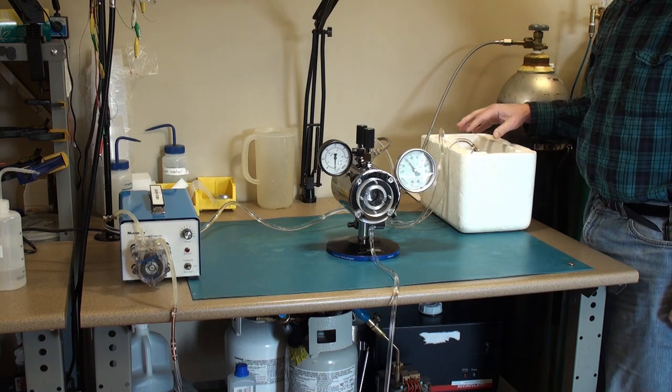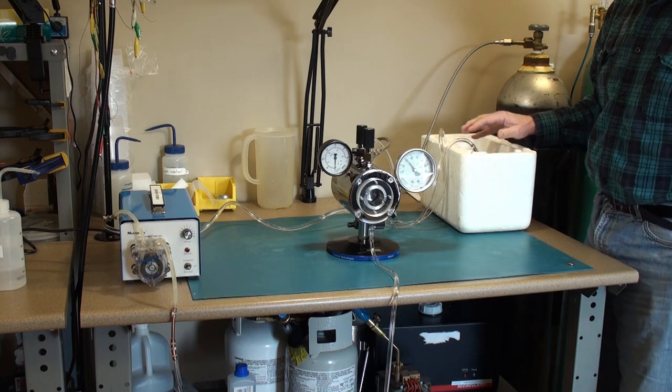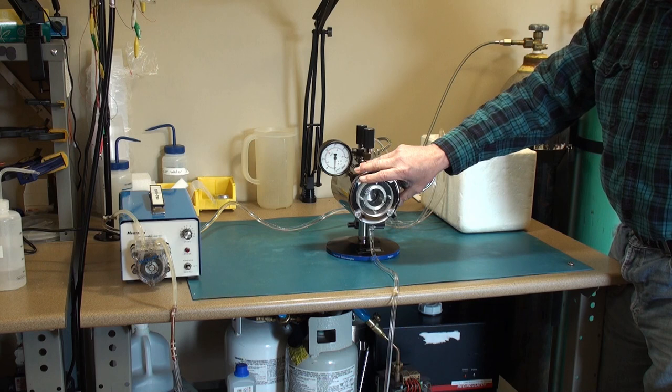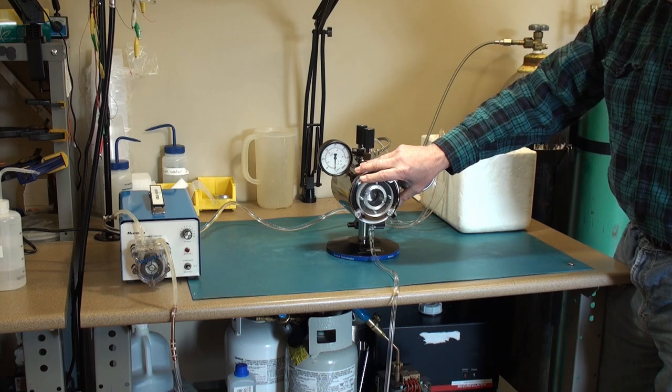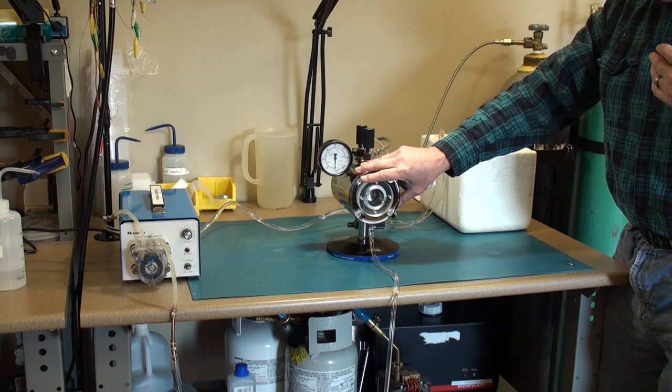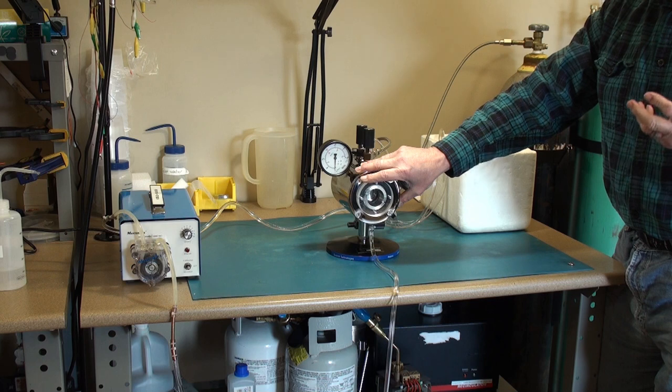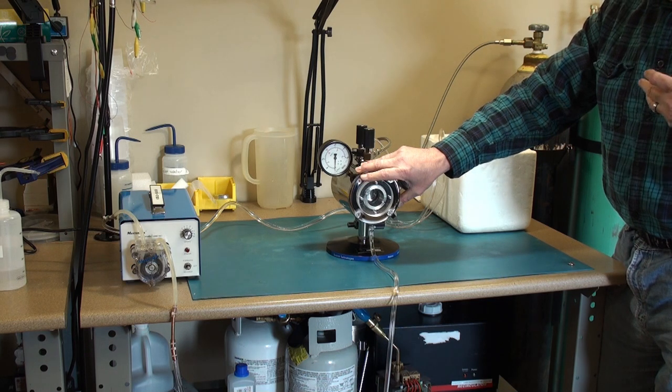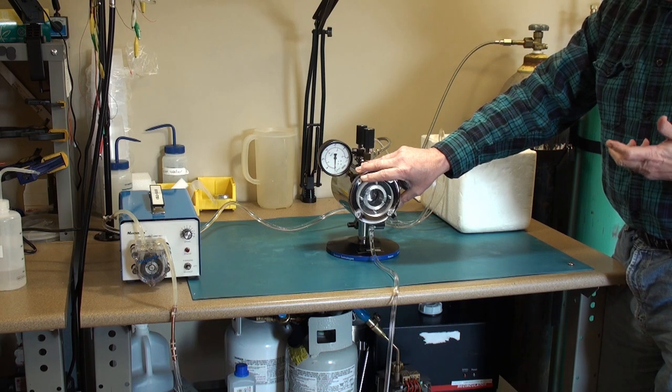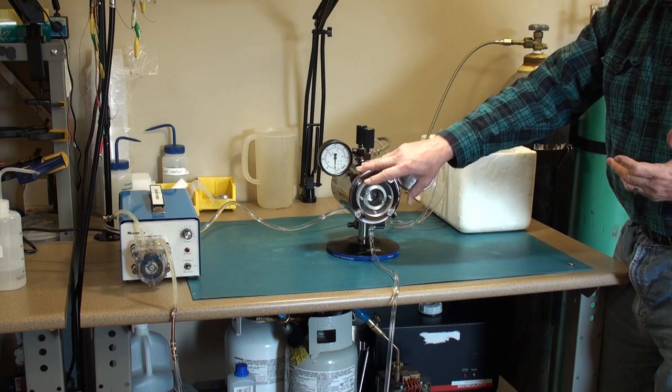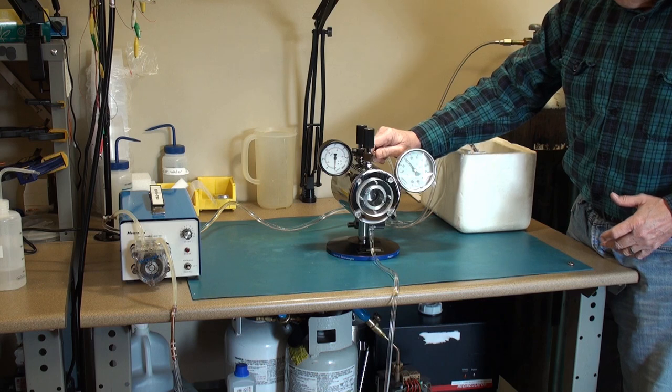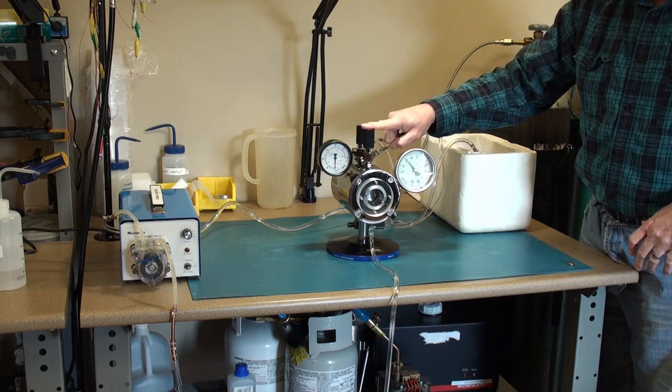To make the water temperature go down to 4 degrees. It does take quite a bit of time for this mass to cool down to 4 degrees, but you should get it as cold as possible because then you can fill the chamber with as much liquid CO2 as possible, which makes raising the pressure to achieve critical point pressure all that much easier.